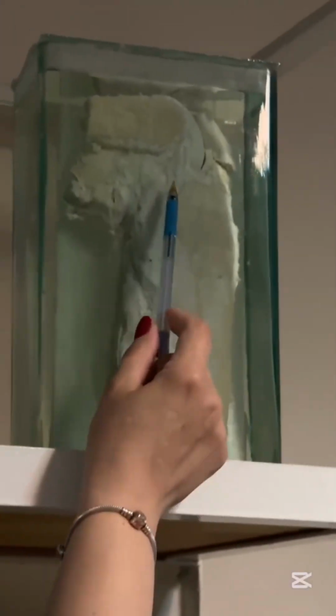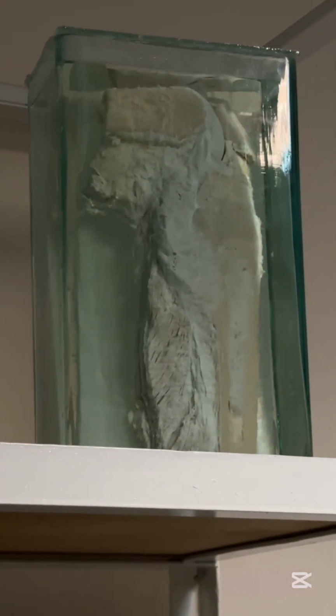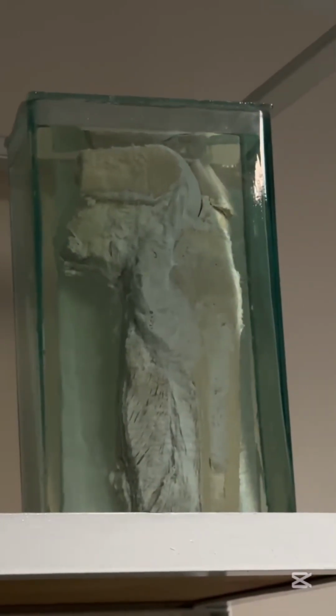Osteosarcoma, you see tumor. That is malignant tumor of bone, of tibia. Sarcoma, malignant tumor of mesenchymal origin. It has invasive cells and usually hematogenous.